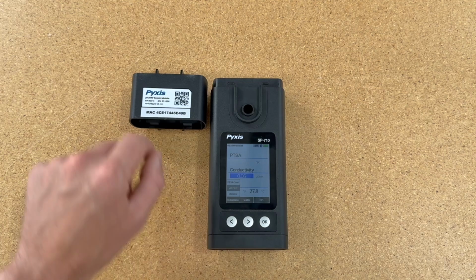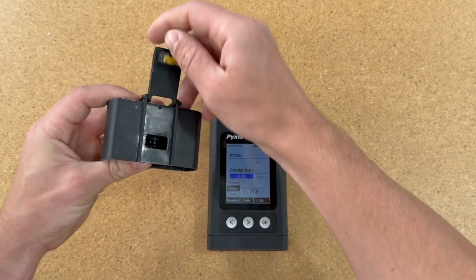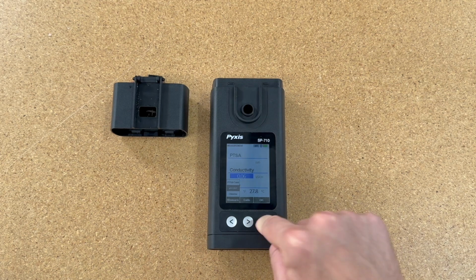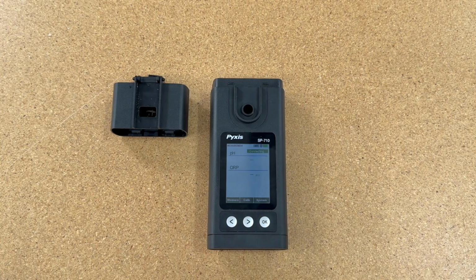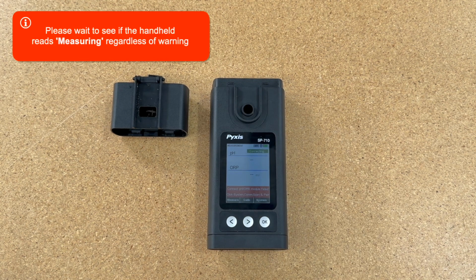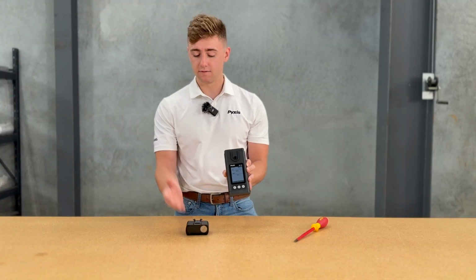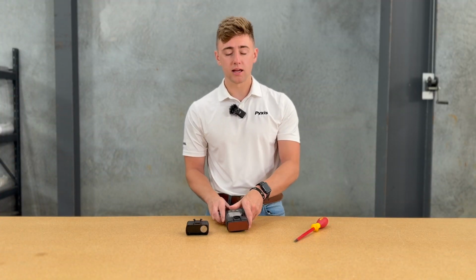If we flip open our lid just to ensure that this guy's ready to go, you should see in the top right corner a message that says connecting, and then soon it'll say measuring. If you get a little red warning down at the bottom that says this module has failed to connect, that might seem a little different from the top right corner that says connecting. If it says connecting in the top right corner, give it a second and it should say measuring and connect to the device. And the base of the device is now measuring for the residual of pH and ORP via the Bluetooth pH ORP module.